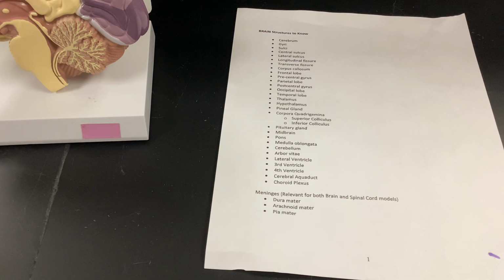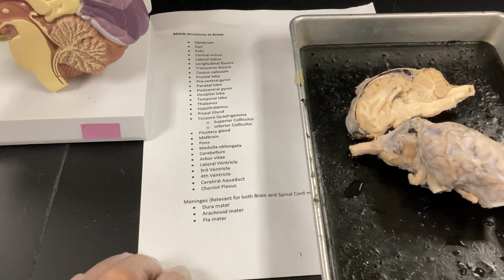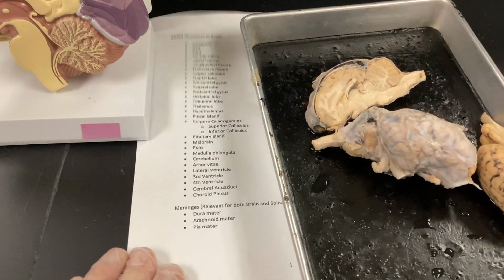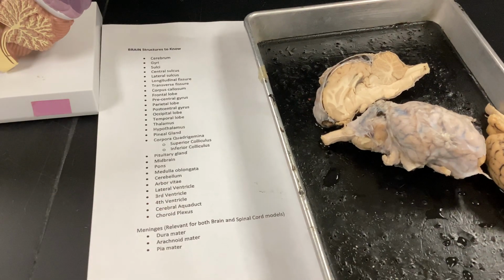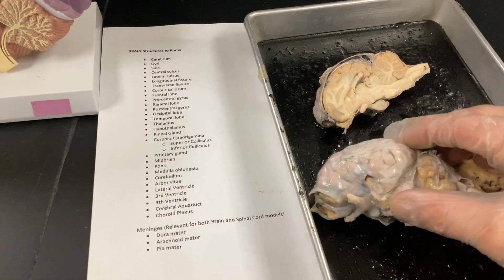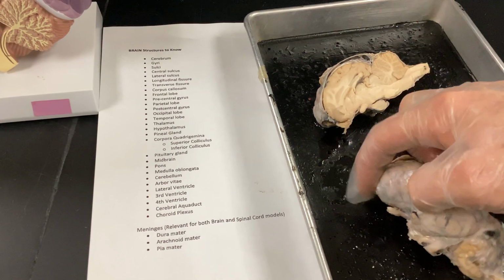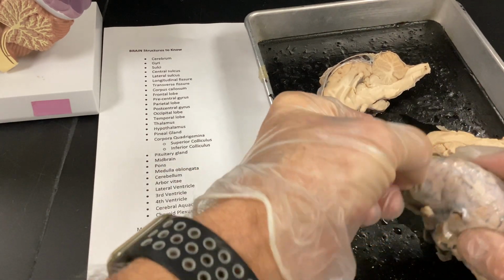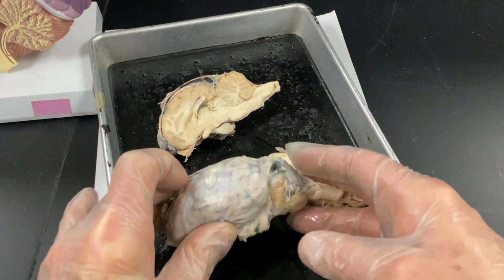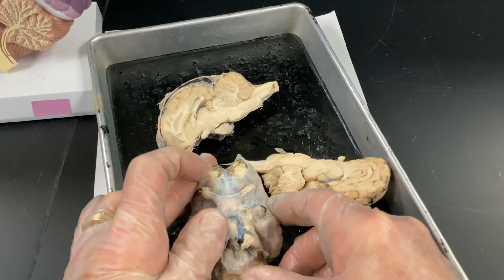All right, so I'm going to hopefully try to get all this in here. So I'm going to go over dura mater, arachnoid mater, and pia mater. And remember, this is from superficial to deep. Okay, so that probably looks like an alien a little bit. All right, so this is literally the dura mater. I'm trying to make sure I record this and see what I'm doing. So, the camera. All right, so that's the inferior portion. Dura mater. See how tough that is?